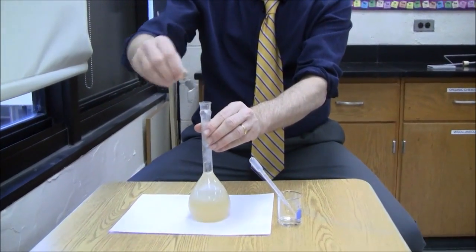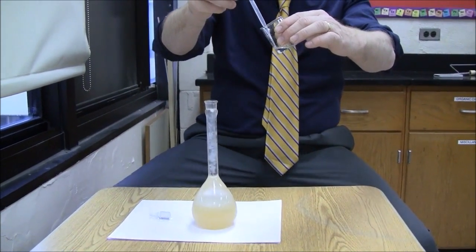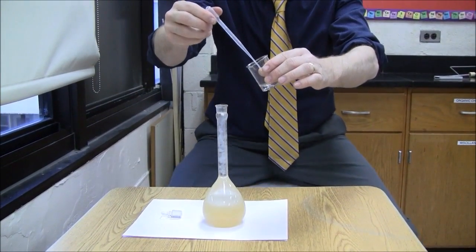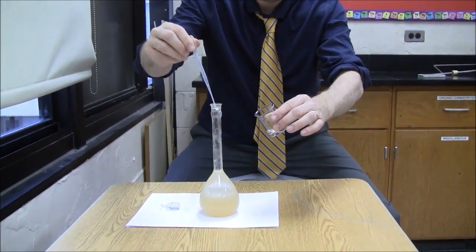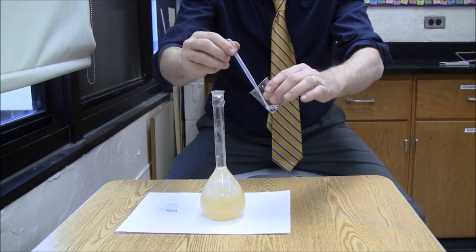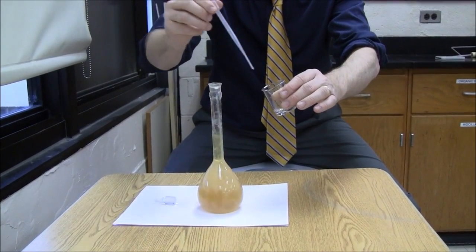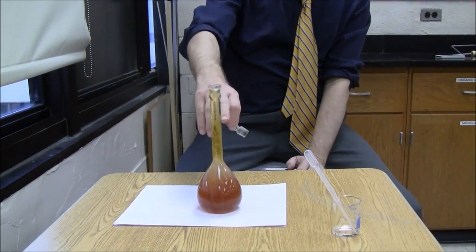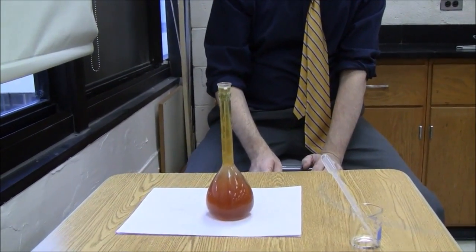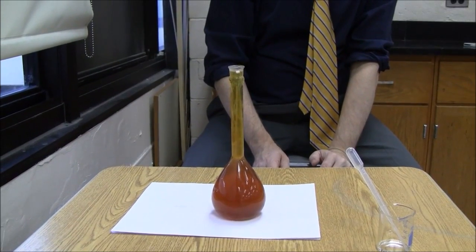Now I have to reduce the pH for the next part to work. Carefully remove the stopper and add two millilitres of concentrated sulfuric acid — move back a bit in case of spills. That was just under two, so this is an excess; it doesn't have to be exact. You can see the reaction taking place — the new brown colour is iodine molecules being formed, and the cloudy manganese 4+ has turned into manganese 2+.